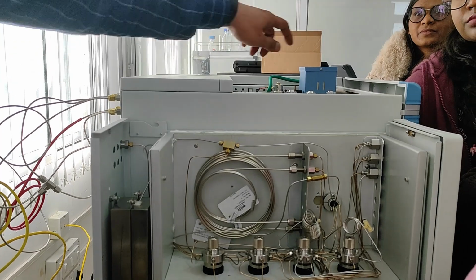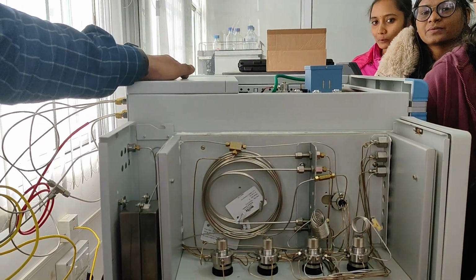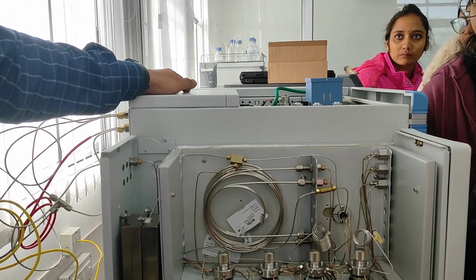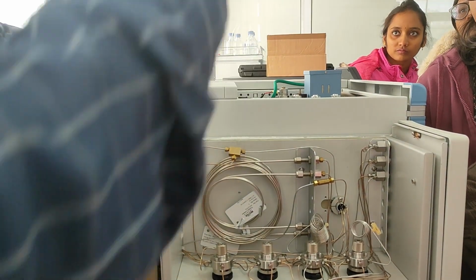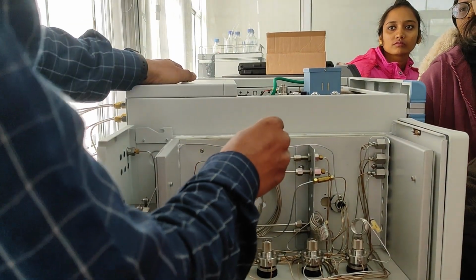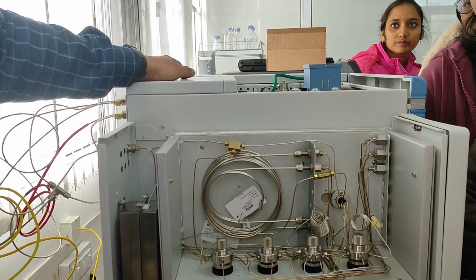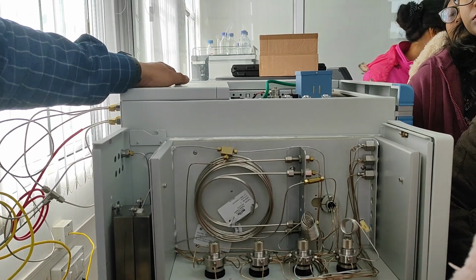And inside the oven the column is molecular sieve. It can separate oxygen, nitrogen, hydrogen, and the elution order is methane first, then CO. And if you use only this column, CO comes first, then methane, and the separation will not be clear. It's a compromised separation.